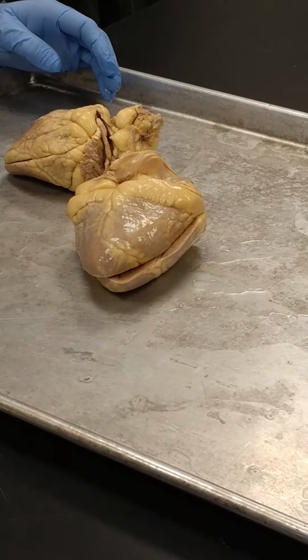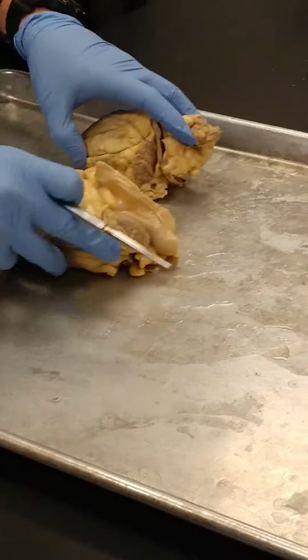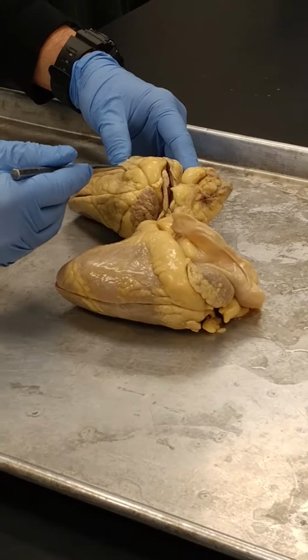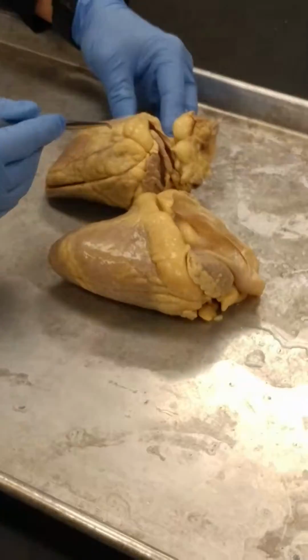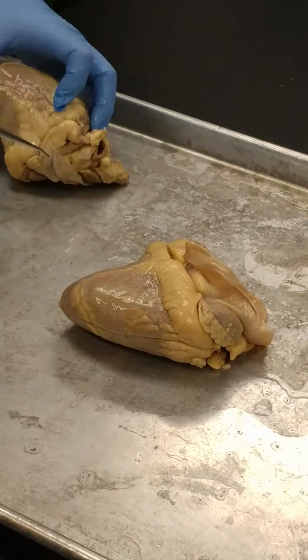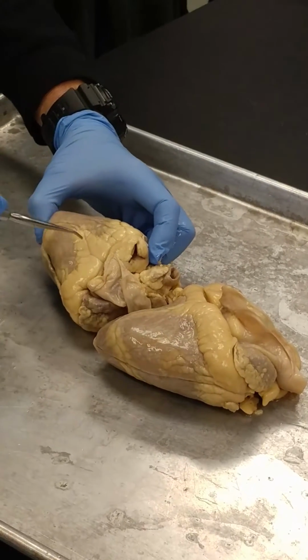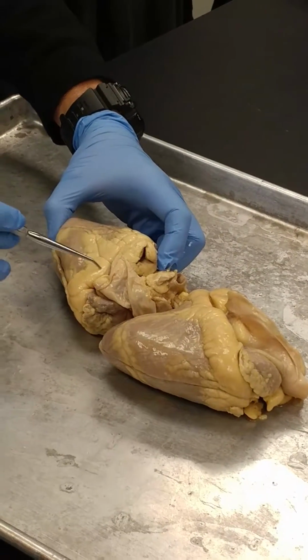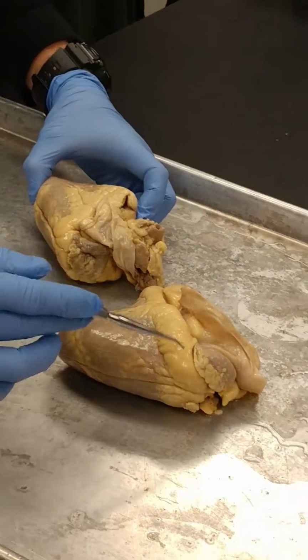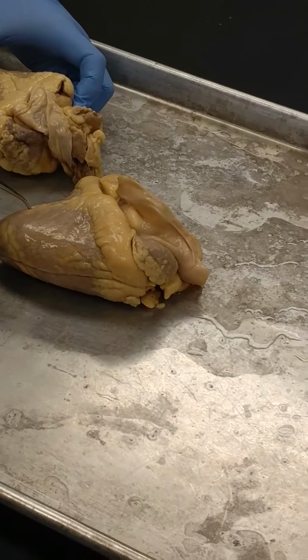Covered that. Visceral pericardium, myocardium, endocardium. Coronary blood vessels. You're not going to really see a good shot of the coronary blood vessels here, but I will show you where they lie. For instance, these are coronary arteries coming down. If we flip it over on the back side, you can also see where they reside. Now, you'll notice with these vessels is a lot of fat. Those vessels are surrounded by fat.